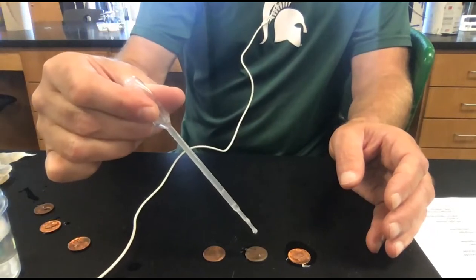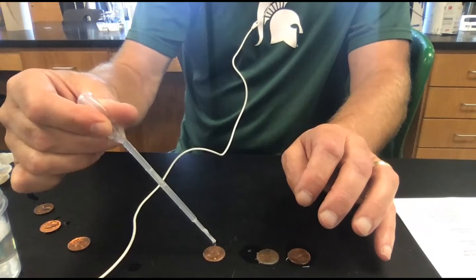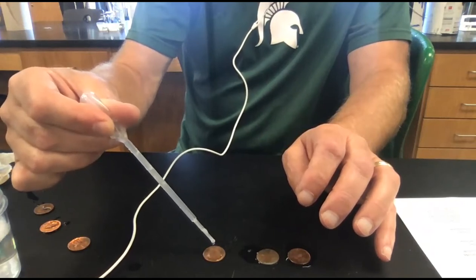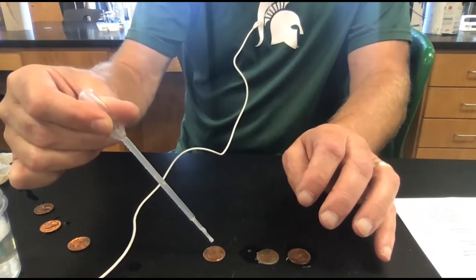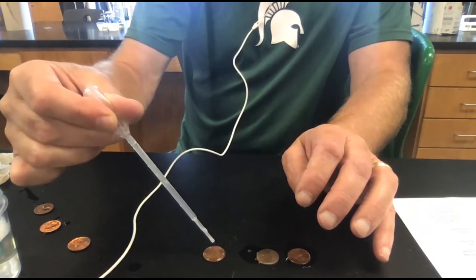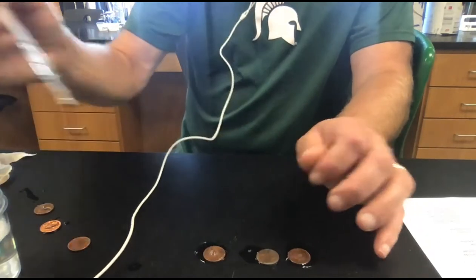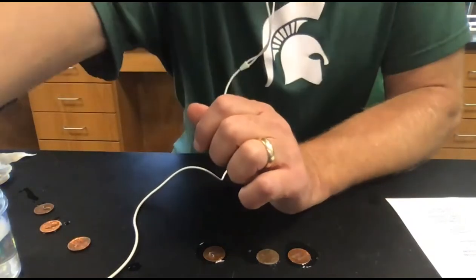1, 2, 3, 4. Oops, I'm not going to count that one. 1, 2, 3, 4, 5, 6, 7, 8, 9, 10, 11, 12, 13, 14, 15. That one broke at 15.